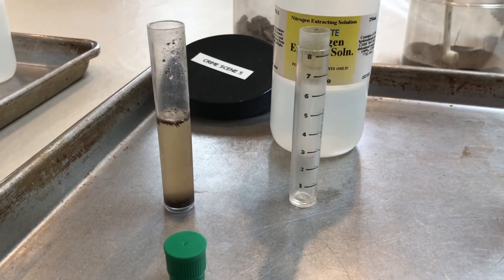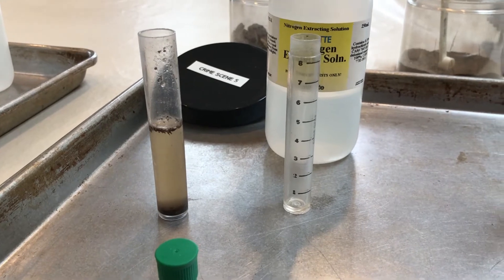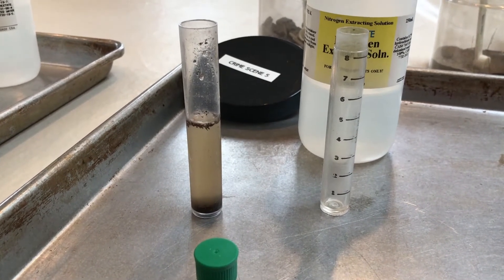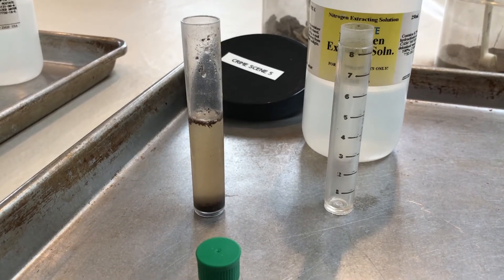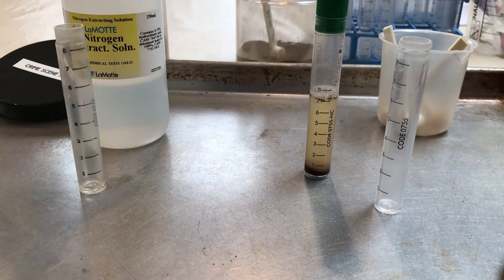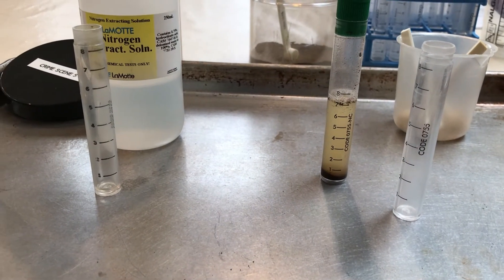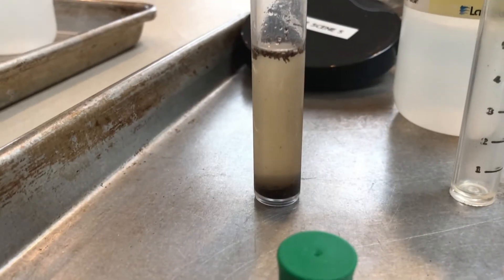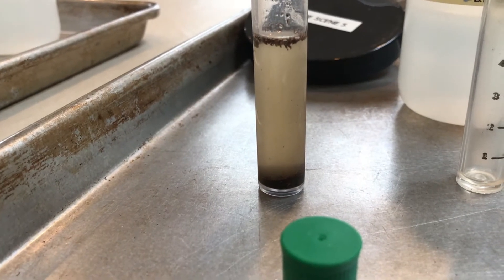Hey ladies and gents, we're back for part two of our nitrogen testing. So we have already allowed our nitrogen extraction solution to do its thing on our soil samples. We agitated them for one minute. At this point all of the nitrogen should have been extracted from the soil and it's floating at that fairly clear layer above the soil layer at the bottom.